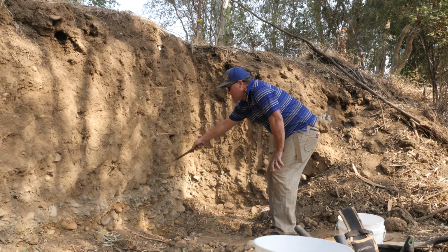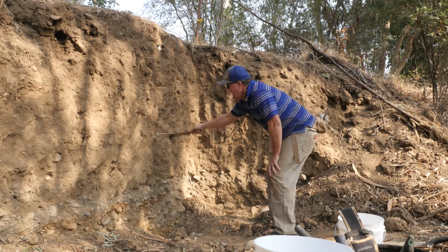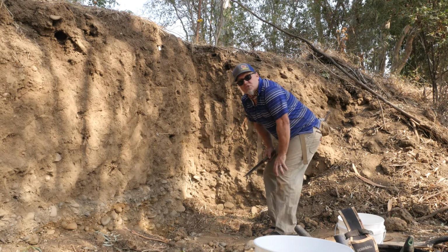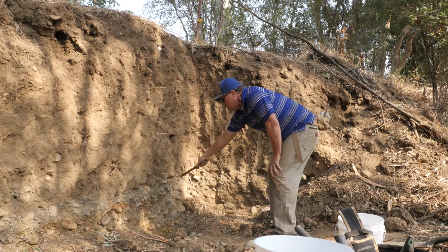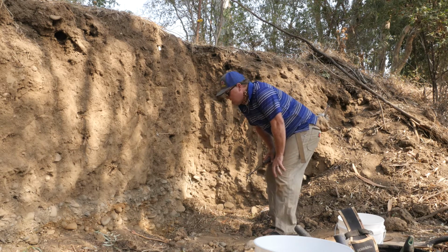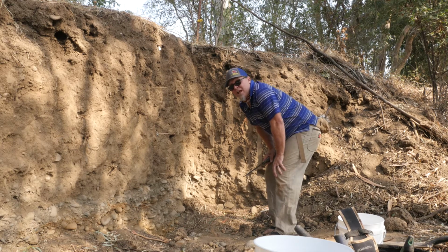This is fairly undifferentiated, right? It's not aggregated as nicely as this. And you see, once again, a drop in color. Right below that was the old stream bed that was sitting here, and you can see how clean it is, and you can see some evidence of some accumulation of iron oxides and other things down in the profile. Pretty cool thing for us to talk about for the rest of the semester.